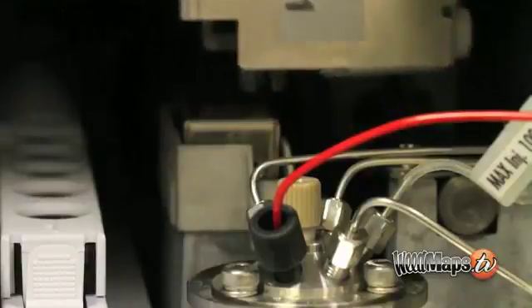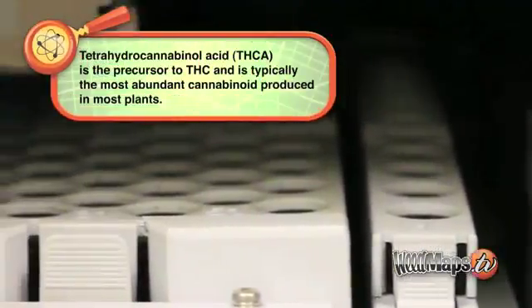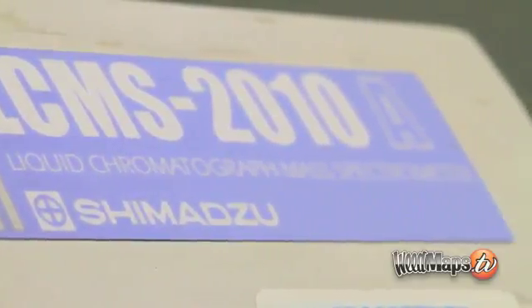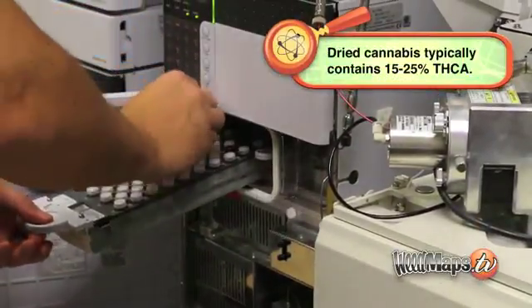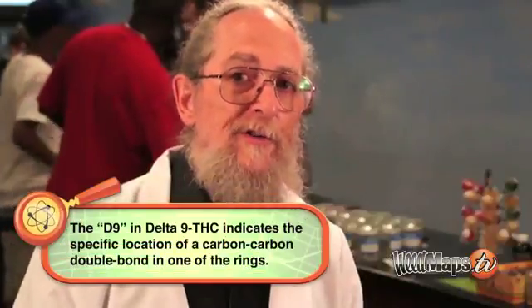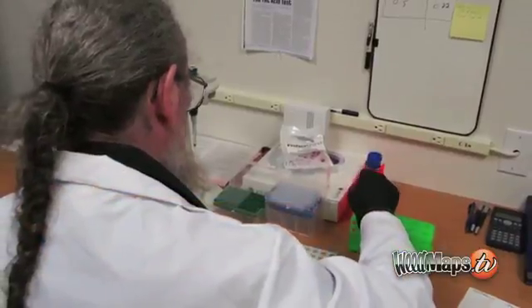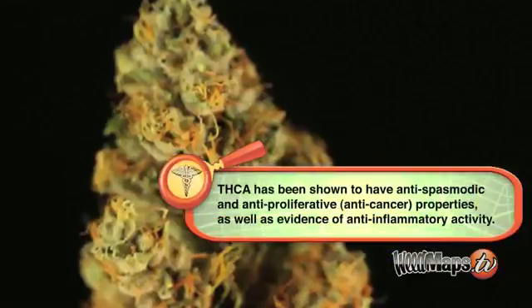The majority of laboratories currently out there are using methodologies that have been available for the last 50 years. A more modern instrument that's only been available for about the last 15 years in any practical way has been liquid chromatography mass spec. The reason we chose that particular instrument is that with gas chromatography, you can only basically analyze for the neutral cannabinoids like delta-9 THC. However, we now know, especially since people have started analyzing at the beginning of this new century, we're starting to focus on all the acid groups as well. So if there's a delta-9 THC, there's also a delta-9 THC acid, and that's true with all of the cannabinoids.